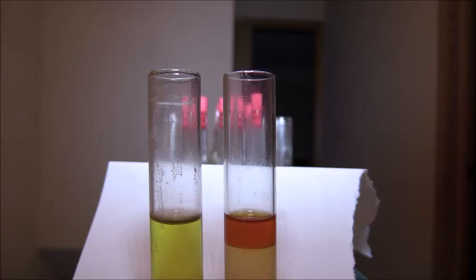So let me explain what you're looking at. The test tube on the right is the control. I mixed a small amount of fatty acids which I had previously made with distilled water and then added 20 drops of Sudan 3 reagent. As you can see there are two layers. The top layer being bright reddish orange is an indication of the fatty acids in solution which always rise to the top. This is what a positive test for fatty acid looks like.